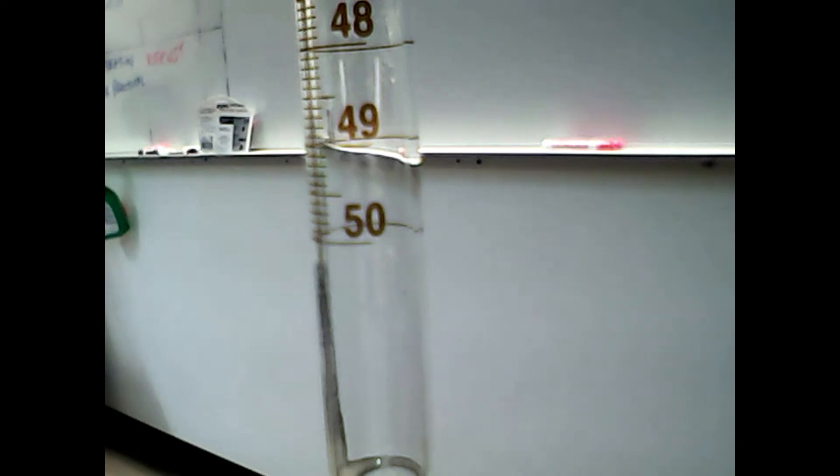We're going to fill this burette with a solution of known concentration. Now, reading a burette is tricky because you want your perspective to be right, and you're reading from the bottom of the meniscus.